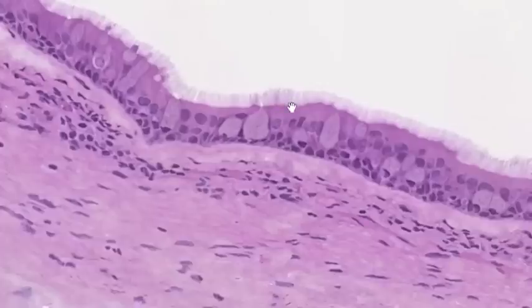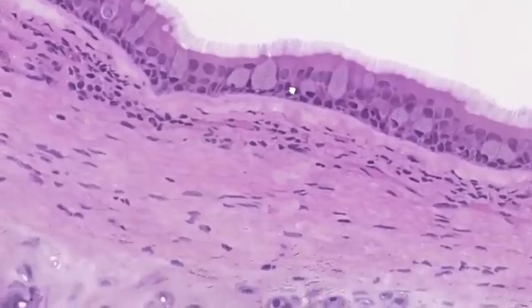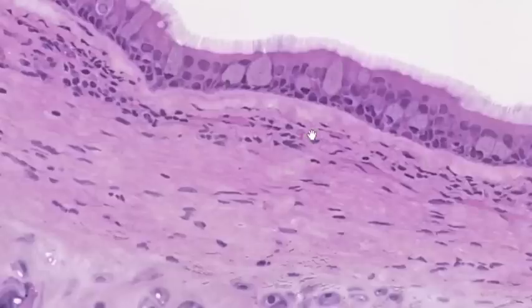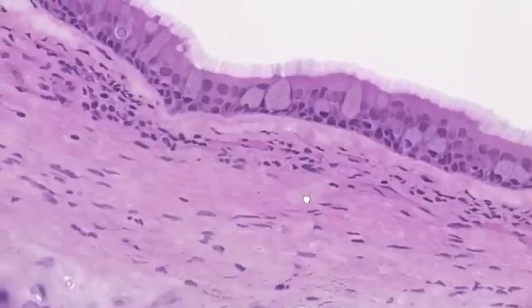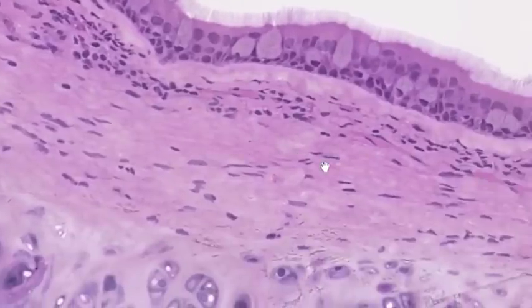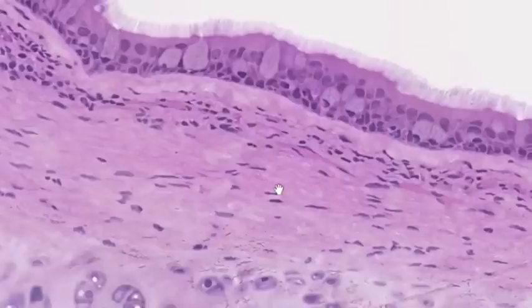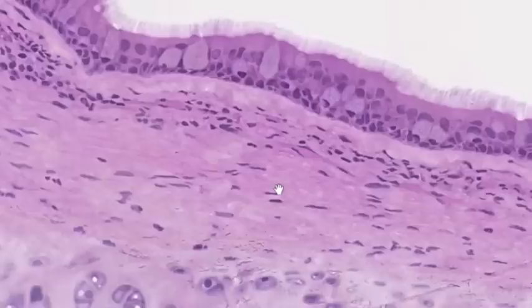This is respiratory epithelium. The epithelium rests on a basement membrane, and beneath that there are variable amounts of connective tissue ranging from loose to moderately dense. Around the wall of the trachea you'll see many small vessels — blood and lymphatic vessels. There is a fairly rich vascular plexus underlying the epithelium, which helps shed heat and warm the inspired air.